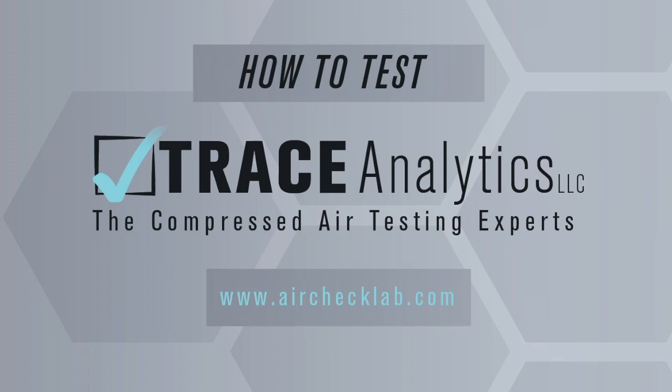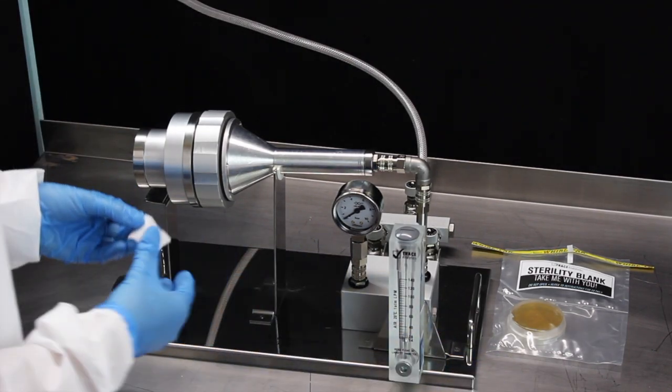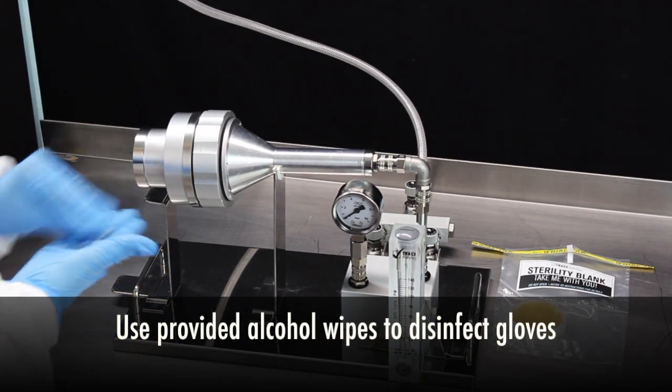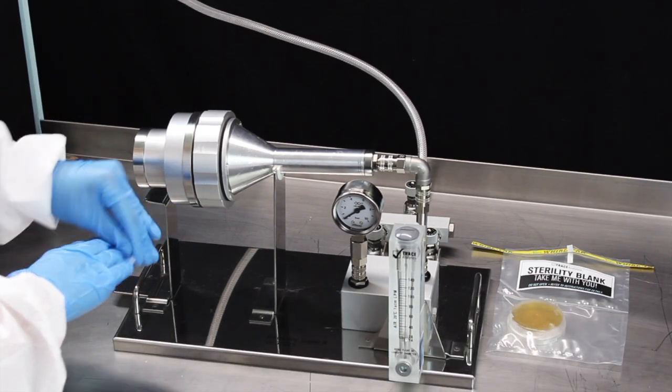This video will show you how to test using the Pinocchio kit. To avoid sampling contamination, change your gloves or disinfect current gloves with alcohol and allow to dry.